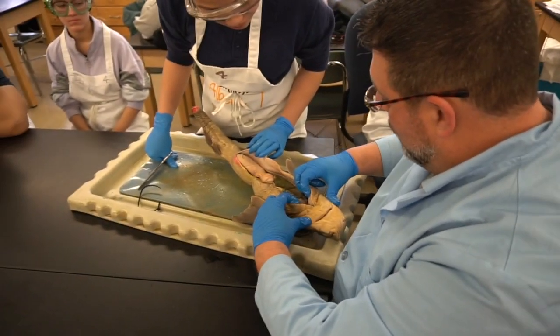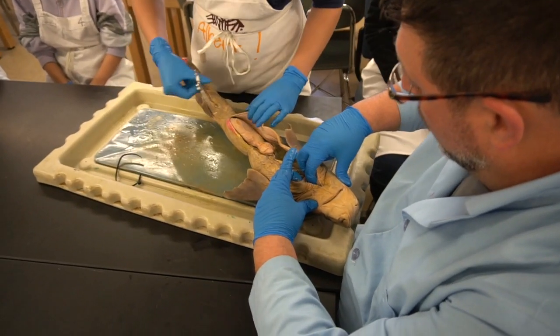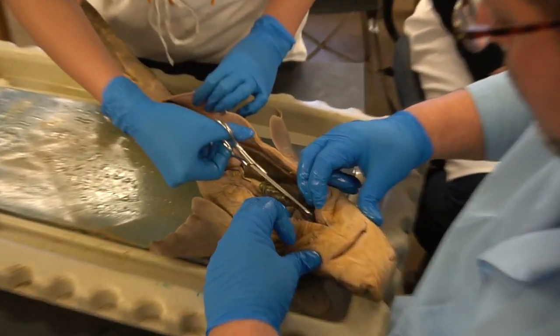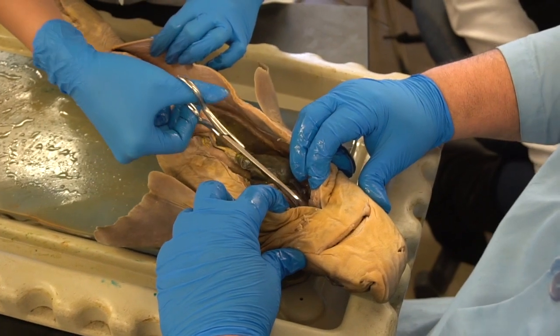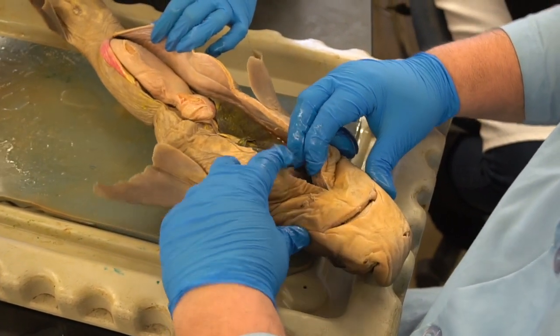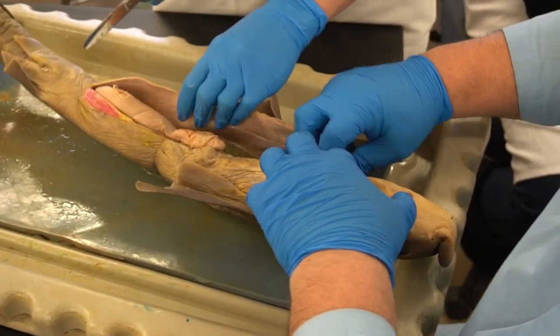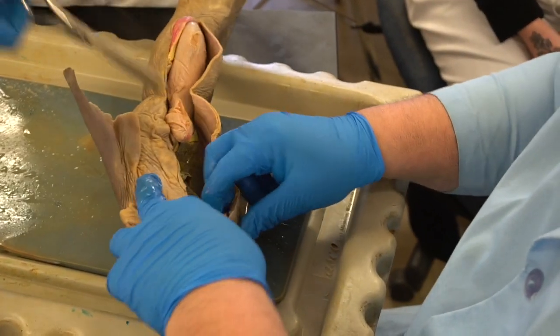So in this case, we want to take the scissors and just cut a little bit more on this connective tissue. Snip it a little bit, so you can have a clearer view of the upper part of the circulatory system. That should be good. Now to aid in pushing this body wall back, you're going to make a horizontal or a vertical incision kind of through the ribbed area here.